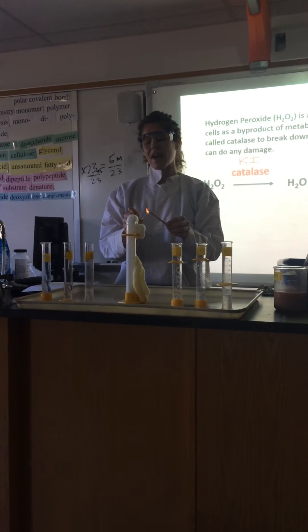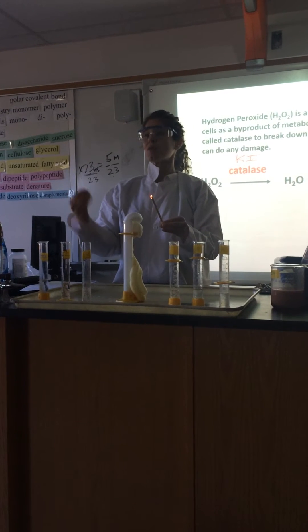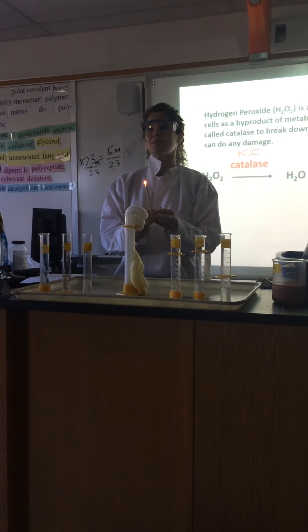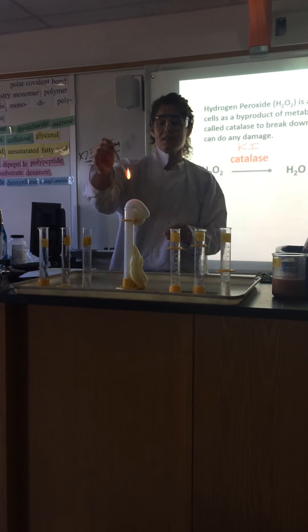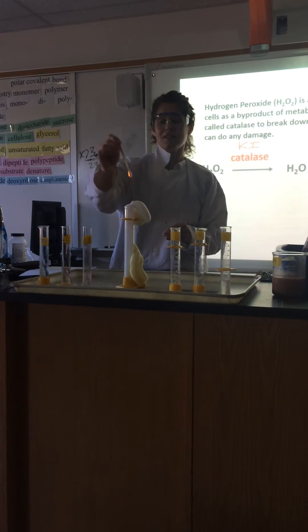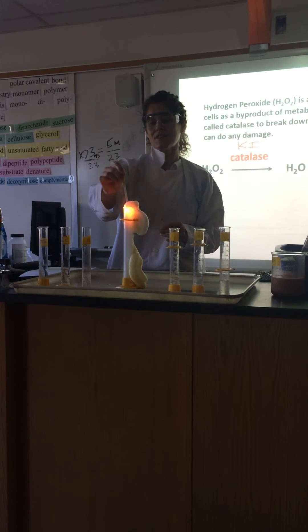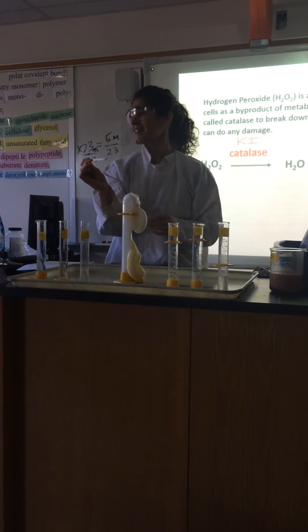You may have actually seen this reaction last year when we were teaching about decomposition reactions in matter and energy, or chemistry. Do you see how it flared up? I can do it again and it flares up — but it's not exploding. You don't hear a boom.